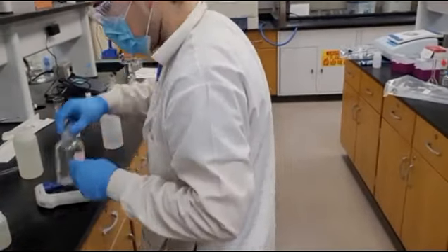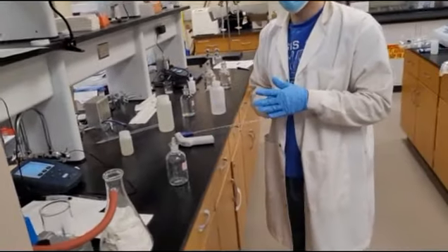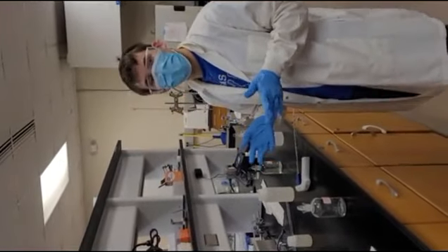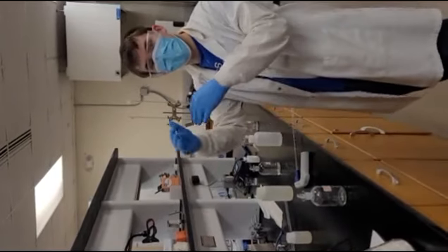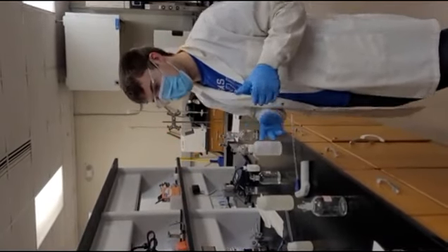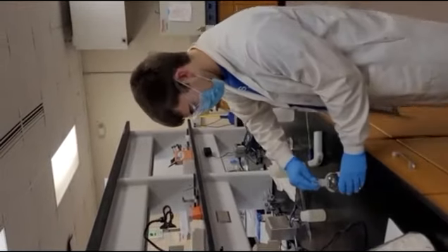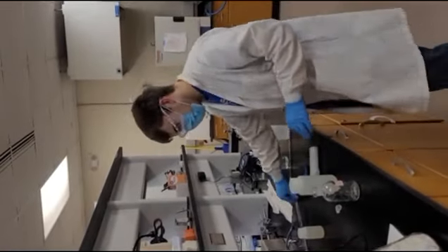We will do effluent. And the effluent BOD, sorry, should be around 2 to 15 milligrams per liter. Again, like I said, we can only measure that dissolved oxygen drop of 8 milligrams per liter without diluting. So, if we do a 2 times dilution, we can get up to 16 milligrams per liter. So we will do a 2 times dilution, which means 150 milliliters of effluent.